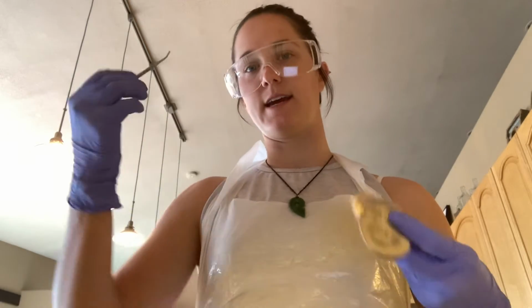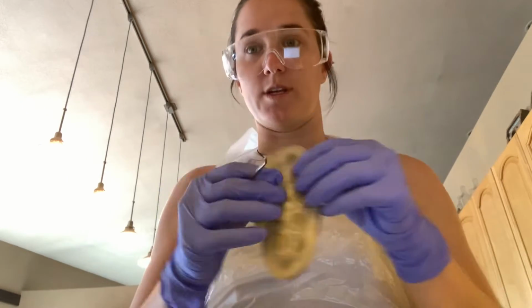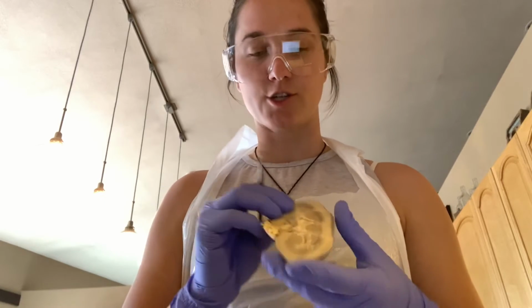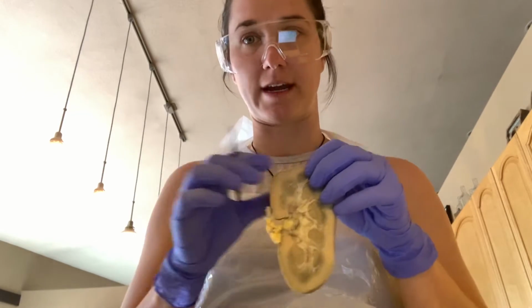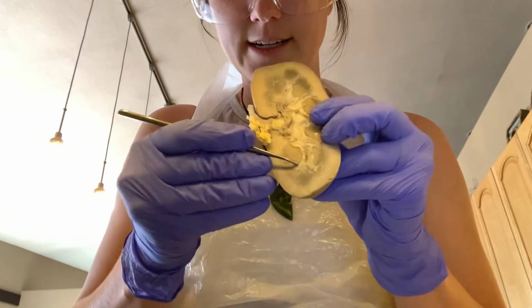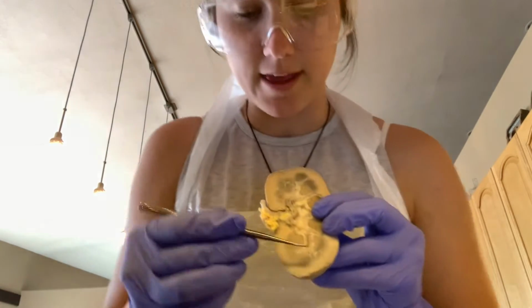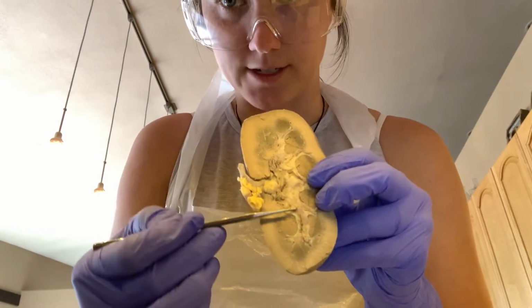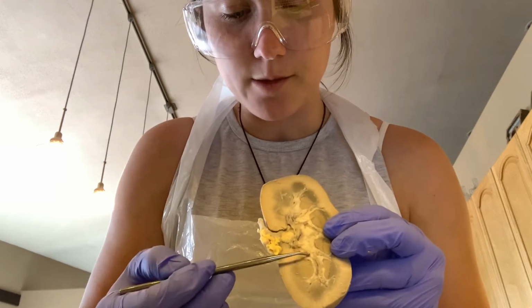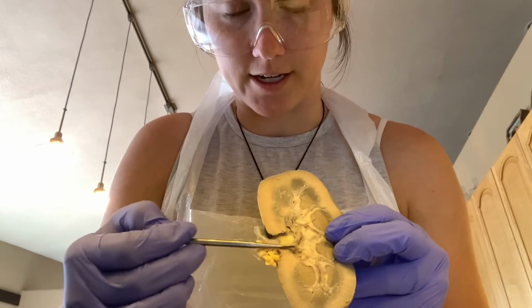Next, as the kidney produces urine and starts funneling it down these tubes to eventually reach our bladder, the first structure this newly produced urine encounters would be the minor calyces. The minor calyces are these tiny tubes here where they funnel in some of the urine coming from the pyramids. And then the minor calyces turn into the major calyces when about 5 or 6 of them come and join in these larger parts here. And then eventually the major calyces form the renal pelvis, which is this large area here.